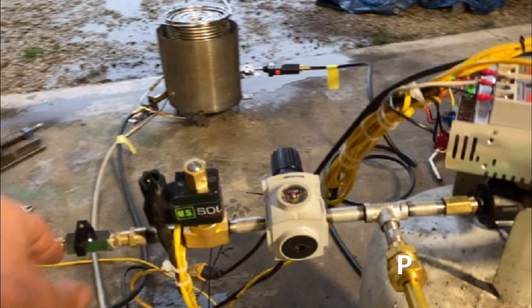It has about a 10-foot hose for the pilot light. I also sent you an additional hose for the main control. Over to the left where I have labeled it, the valve on is the on-off valve. You want to have that in the off position as shown in this video clip — that is where you want to have it when you go to turn everything on and turn on the propane. Just next to that to the right is the solenoid.